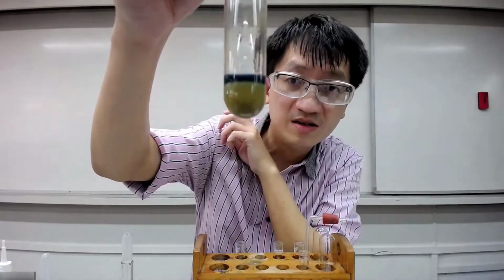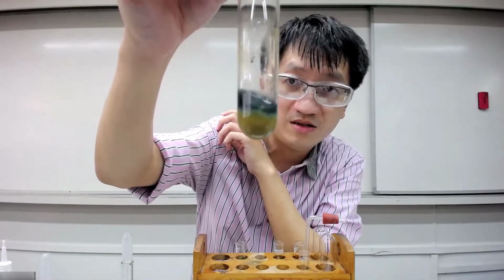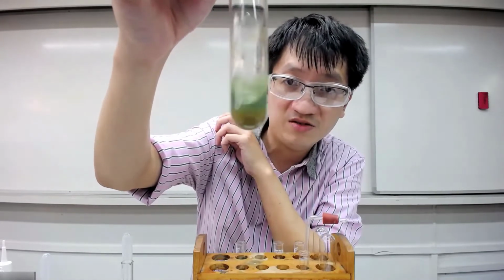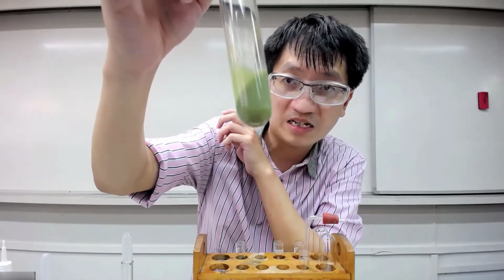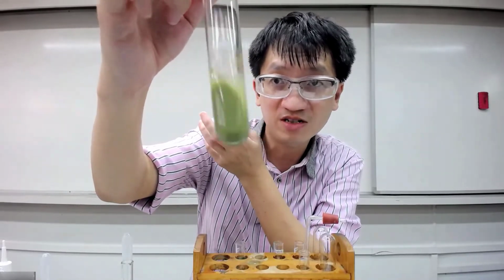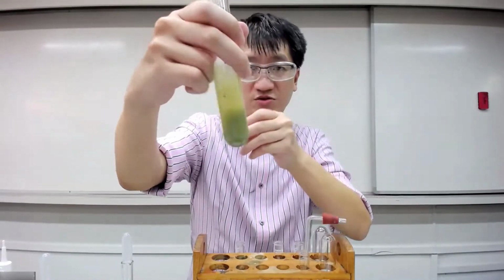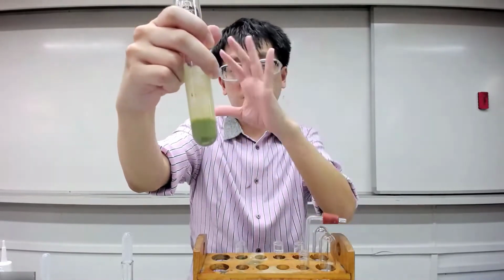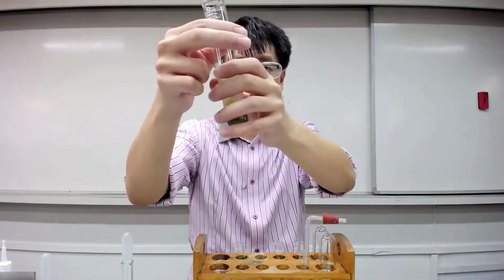Okay, right. So I'm going to swirl a little bit. Can you see some green PPT forming? Actually, they're not green. It's actually a mixture. So now it's very clear already. The solution is now a mixture of PPT, probably a mixture of blue and reddish brown. So right now, I'm just going to swirl and try to observe this color. Again, it goes from brown to now mixed with a little bit of blue. I don't know whether you observe that.